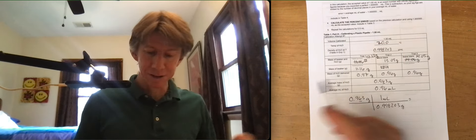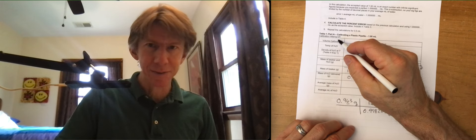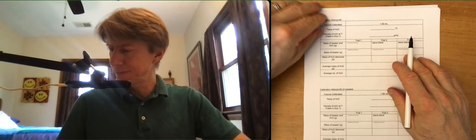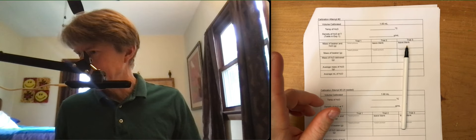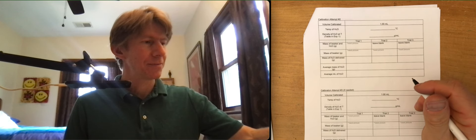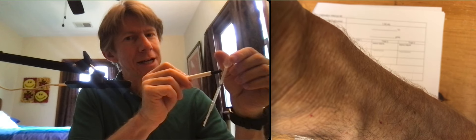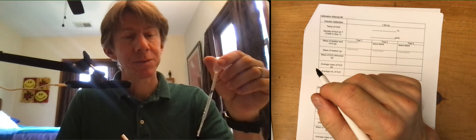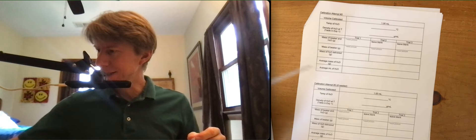Which is fine. We'll do this. This is so worth getting right, by the way. So that was calibration attempt number one. Let's do calibration attempt number two. I do need a pen. I'll use this one, I guess. I need my pipette. And since the 1.00 line was 0.96, which is less than one, I'm going to make the next line higher. And let's see. Got my napkin here.